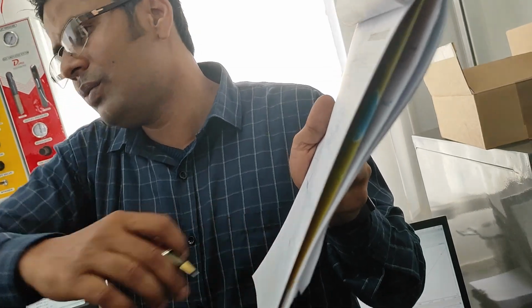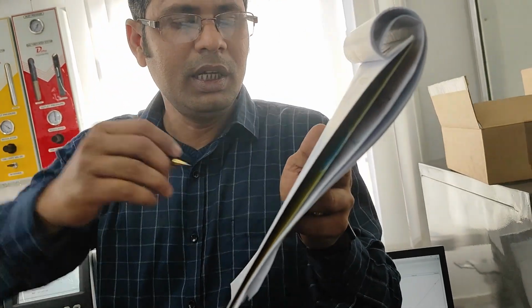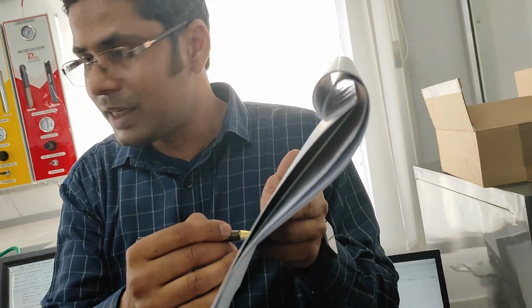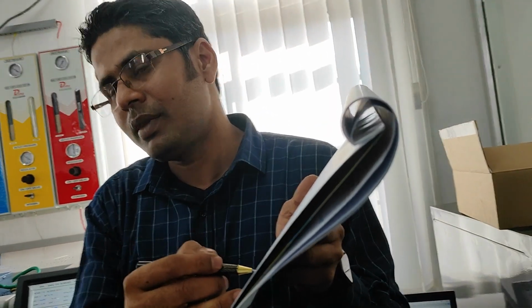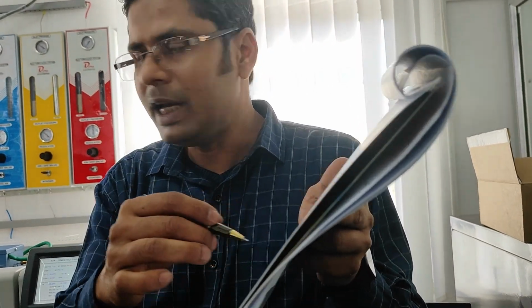If you are getting 2 peaks and both are not saturated, what to do? Which one to report? Only one peak to report. FID? Still, I will go with TCD, because we have calibrated TCD at percentage level. Because here it is coming, that means it is percentage level. So we have calibrated this at percentage level. This one is calibrated at ppm level. So it will tally better. Okay.